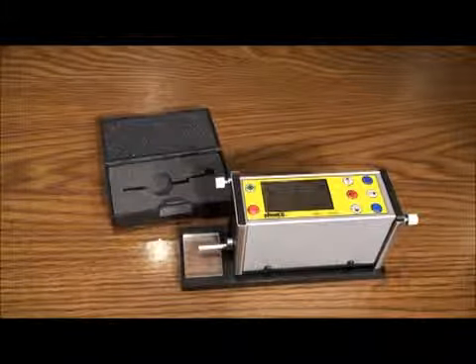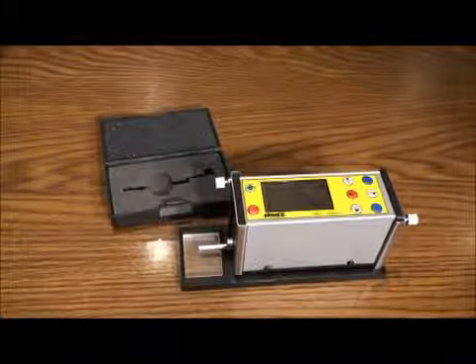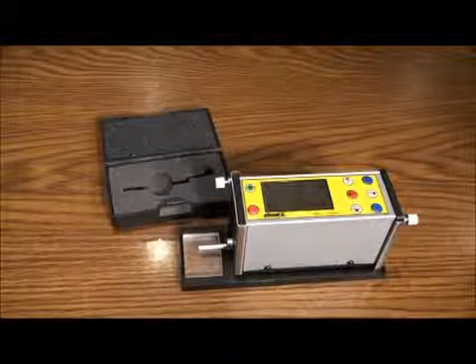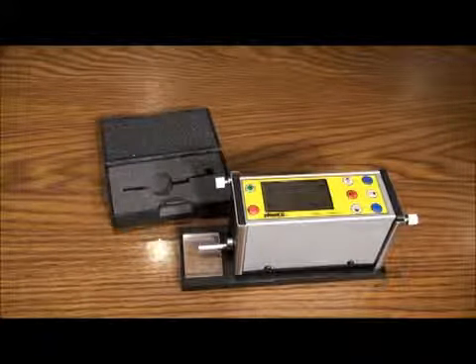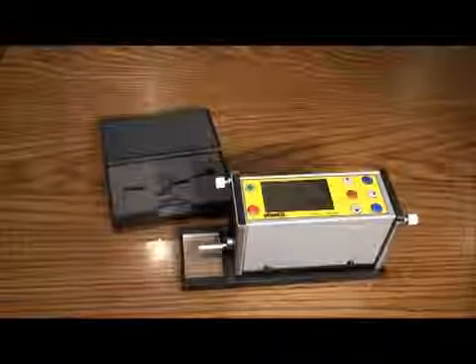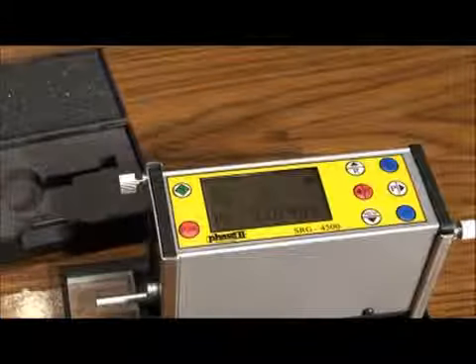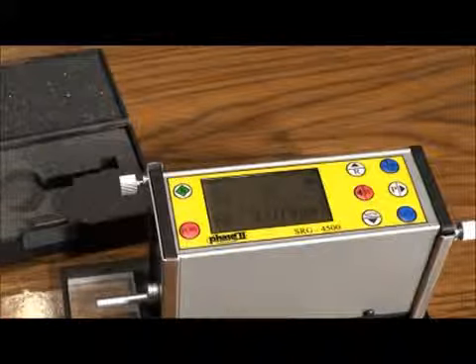Leaving the rear power button on all the time will allow you to retain any calibration memory you establish or change. The main interface screen should be displayed. Each indicator on the screen has a purpose. We will go over in detail the meaning of each and how to make any changes if necessary.